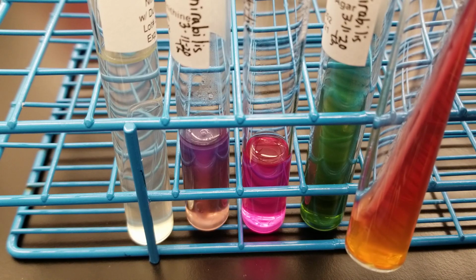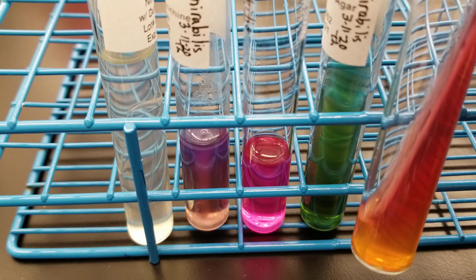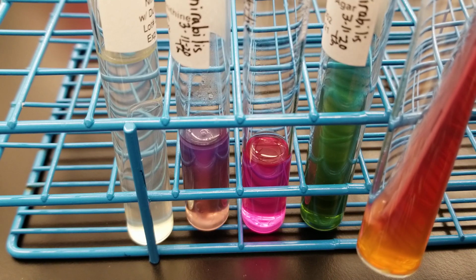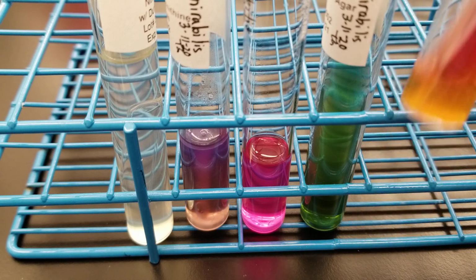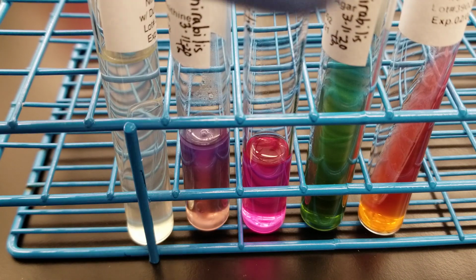We have an acidic butt, so that shows fermentation of glucose, but we have alkaline on the slant showing that those sugars are not being fermented, and it should be H2S positive. And this one, the strain that we have, is usually very, very faint blackening to be seen.